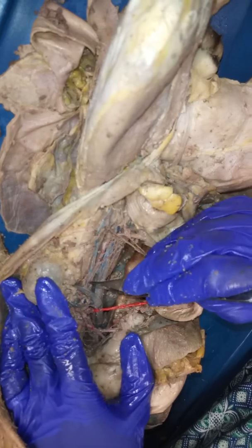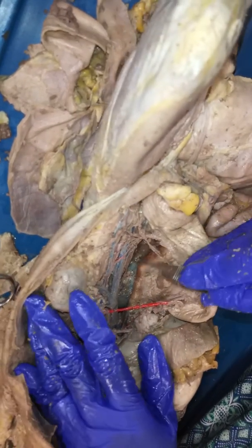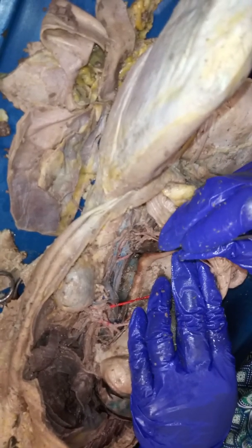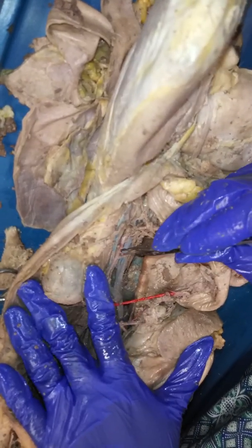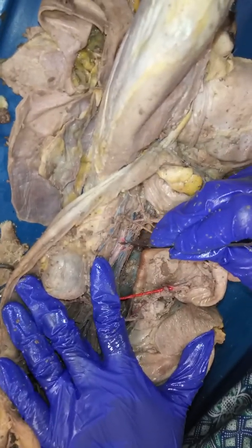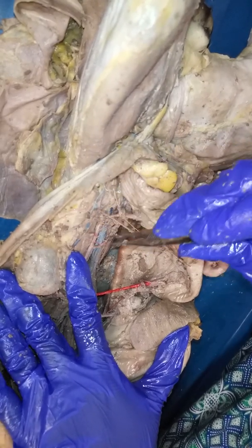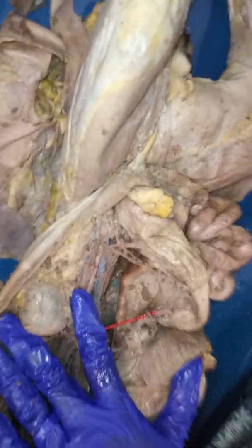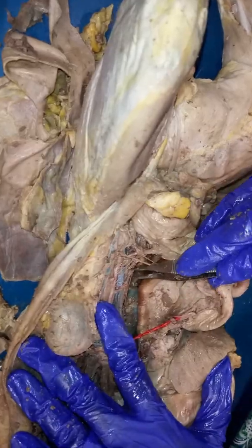Okay, next up. So here's that abdominal aorta. Following it along, the next stop that we're going to reach is this branch, which is going to be the gonadal artery. So there is supposed to be a left gonadal artery also here, but it might have been broken off by accident. But if you see a really skinny one that's like this, only on that side, then you know that that one is going to be the left gonadal artery. Because this one is a male, we can be specific with that, and this is going to be the testicular artery. We can say that.